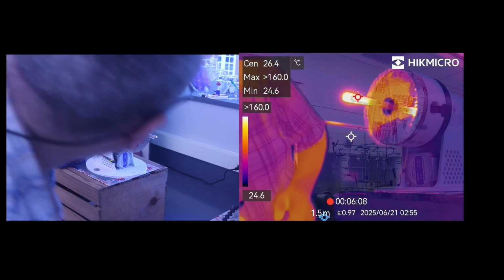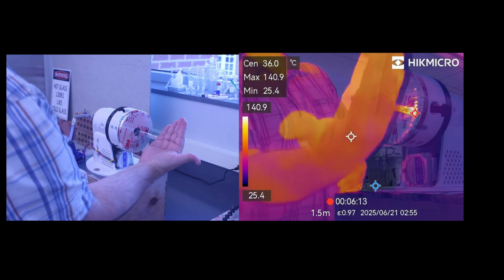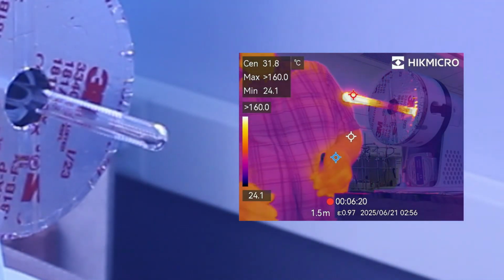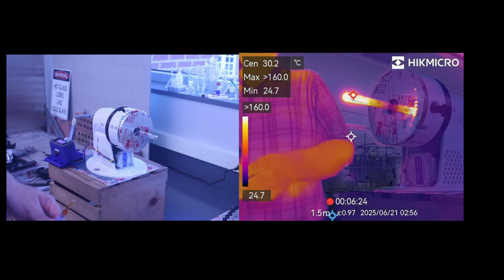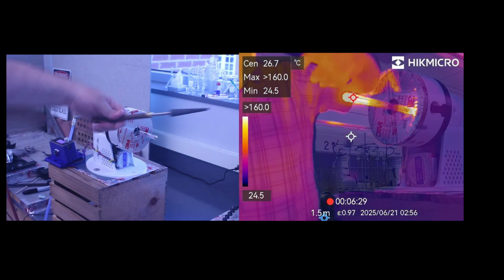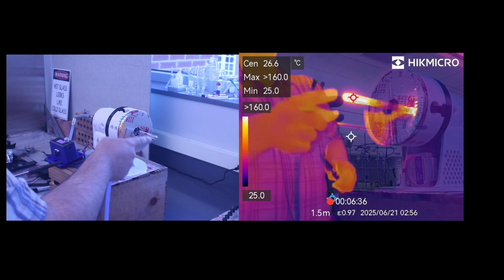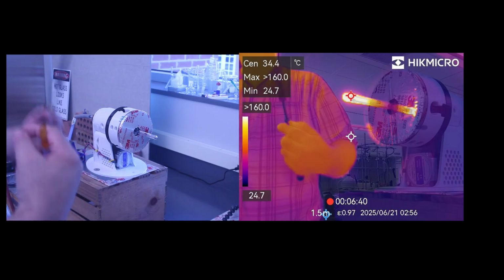I can stop this now and then just take a look at it. And again, looking at this, it seems fine. And again, without a doubt, the most important thing is, could I do a better job by hand, where I would be rotating the glass tube and using a bench burner and then sealing this off? And the answer is no. This test tube that I just made is going to be superior to what I can make by hand.